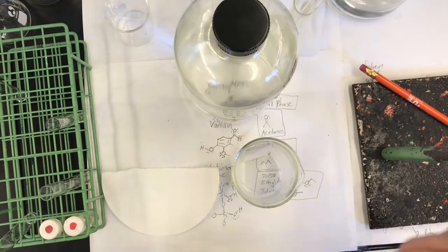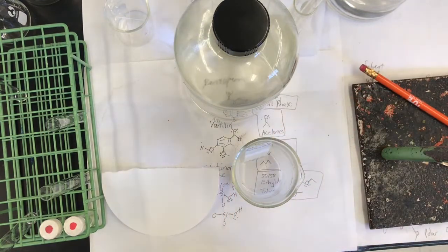It might try to draw solvent off the wick. And it started below my spots. It's already traveling up, but it was initially below the spots. And then I'll put a watch glass over the top of it and wait for it.